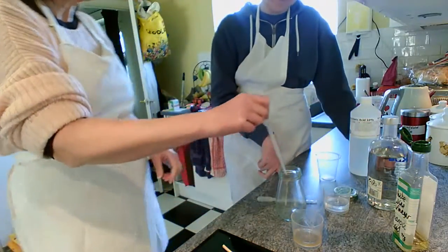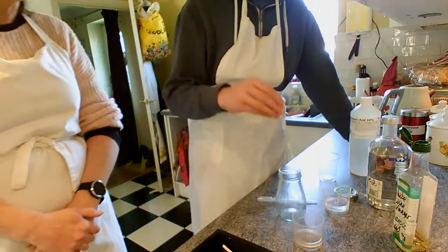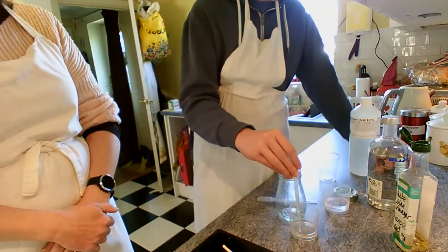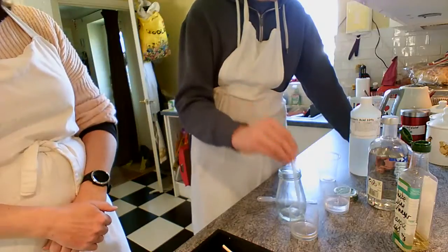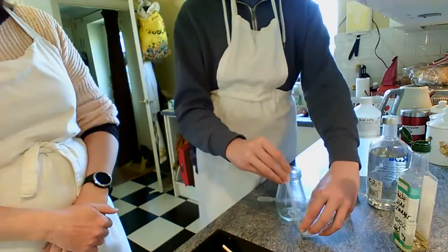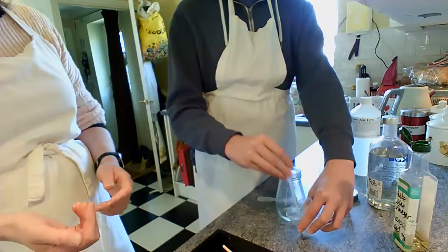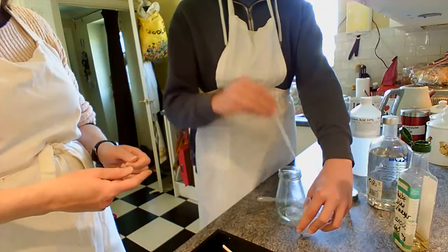Just wing it. Okay, well, here you go. Here's some pipettes. We're going to try and put about the same amount of the ethanoic acid, which is our carboxylic acid, as we put in the ethanol, which is alcohol, and we're expecting to get ester and water off them. Now, it's a 1 molecule to 1 molecule reaction ratio on them.